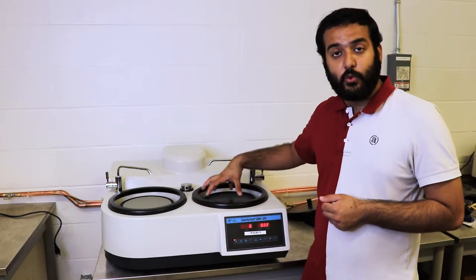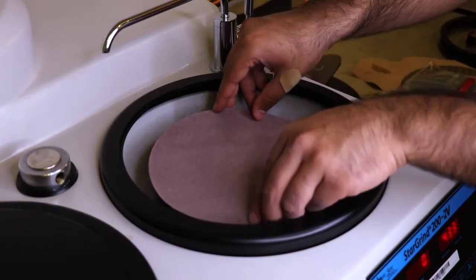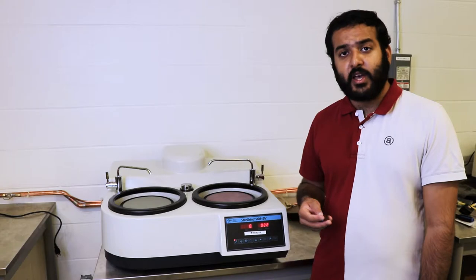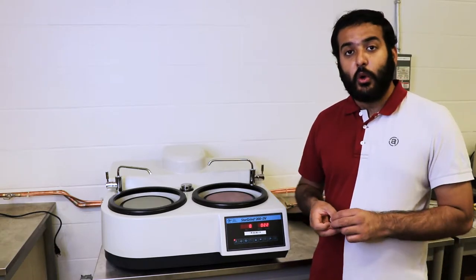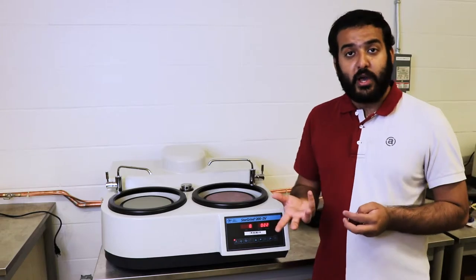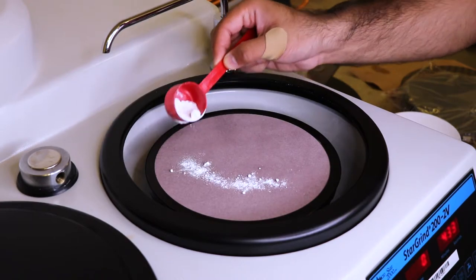Now with the polishing pad, you don't want to keep the water running, because if you do, you're going to wash away all of your powder. When you're applying the powder, you always want to start with a little, like a quarter of a cup, and apply it to the pad itself.